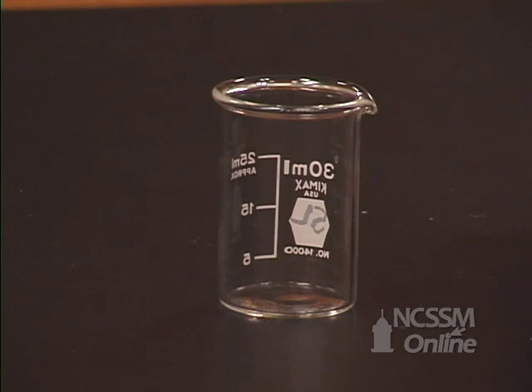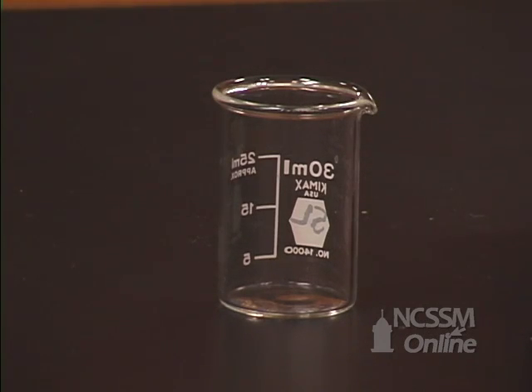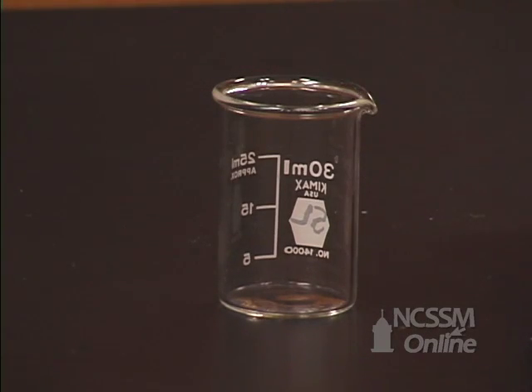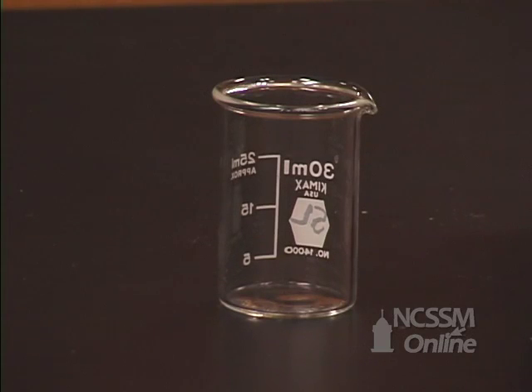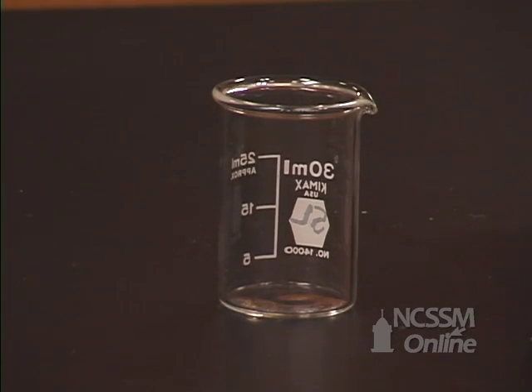We will do a demonstration to illustrate the difference between the thermodynamic control and the kinetic control of the product of a reaction.